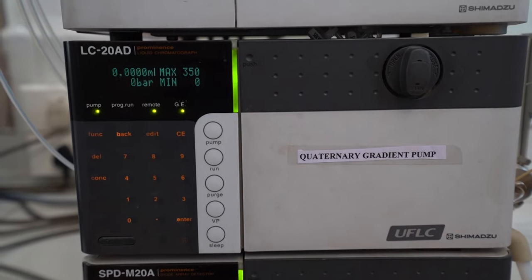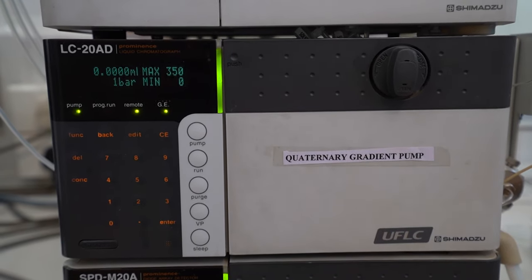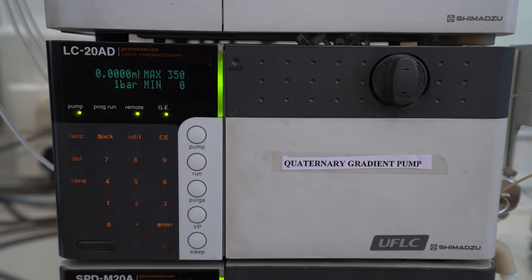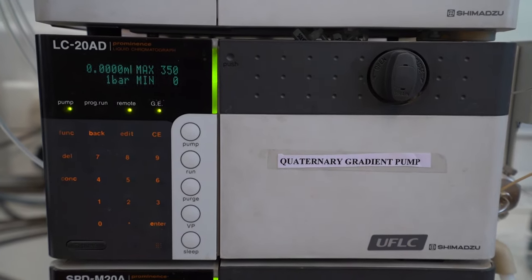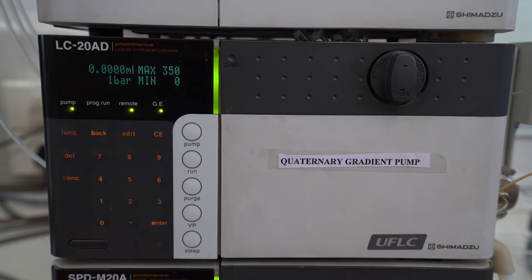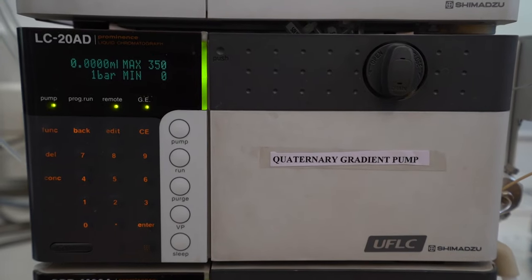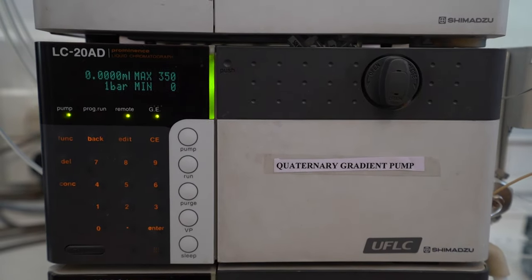The next step of analysis is washing, where double-distilled water is used. Washing is done for 30 minutes, or based upon the previous analysis. To minimize analysis time, the pump is kept running for washing while simultaneously preparing the mobile phase, standard, and sample.